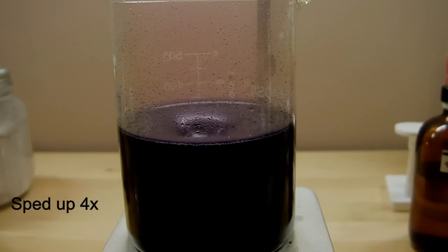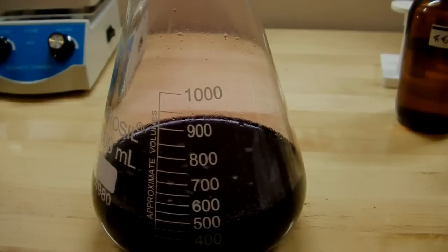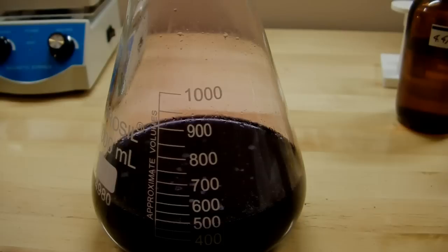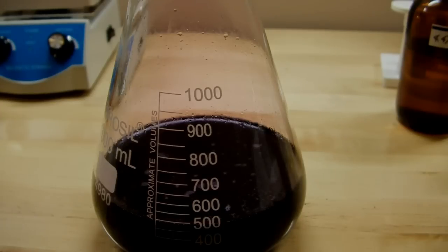Now we got to try to get rid of this. So let's try to neutralize it. I've transferred everything to a larger flask for neutralization and to do that I'm going to add these thiosulfate crystals, sodium thiosulfate. I'm just going to pour that directly in there and let it dissolve.